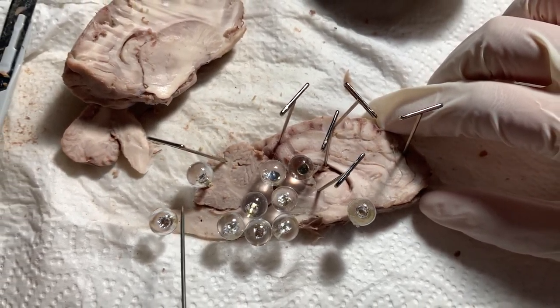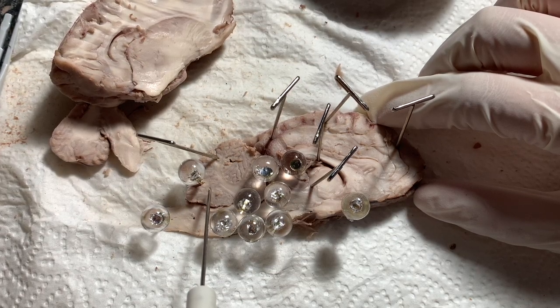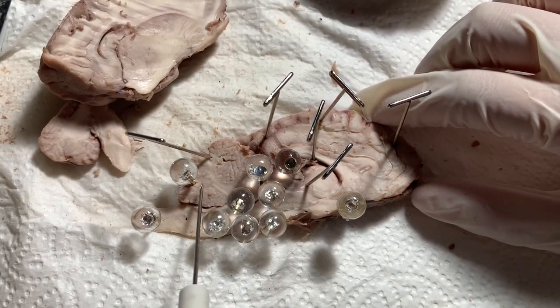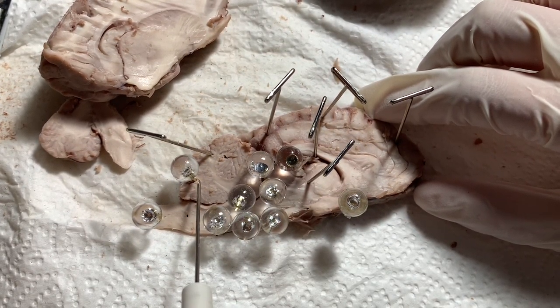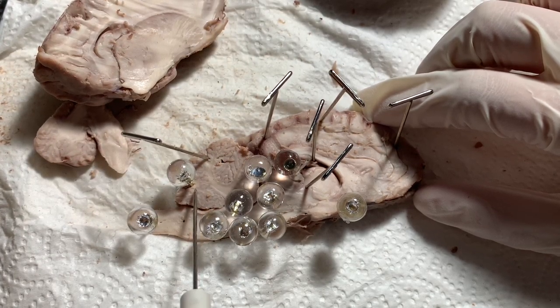Next we have the arborvitae. The arborvitae's function is it is made out of white matter that transmits information throughout the body.